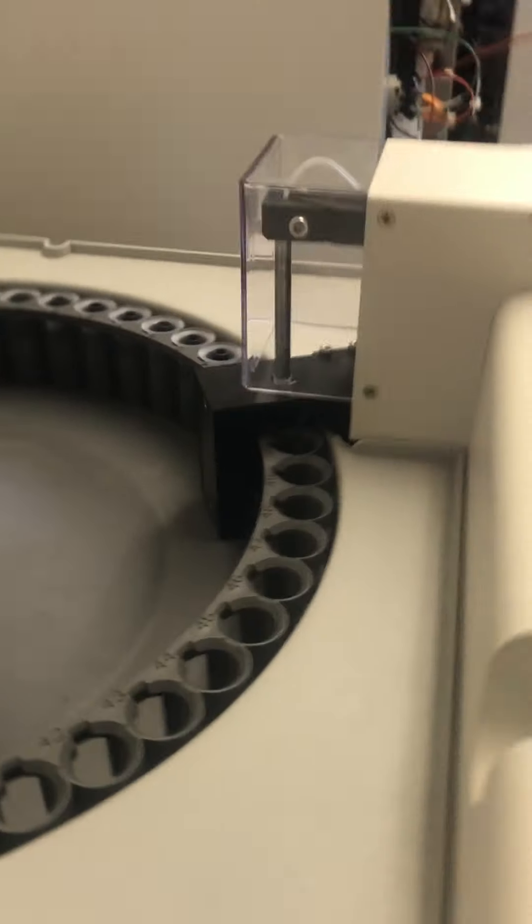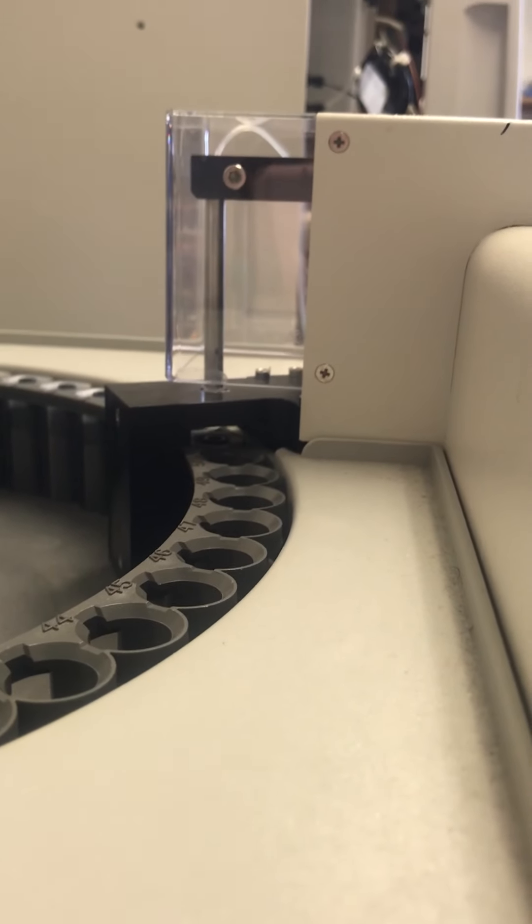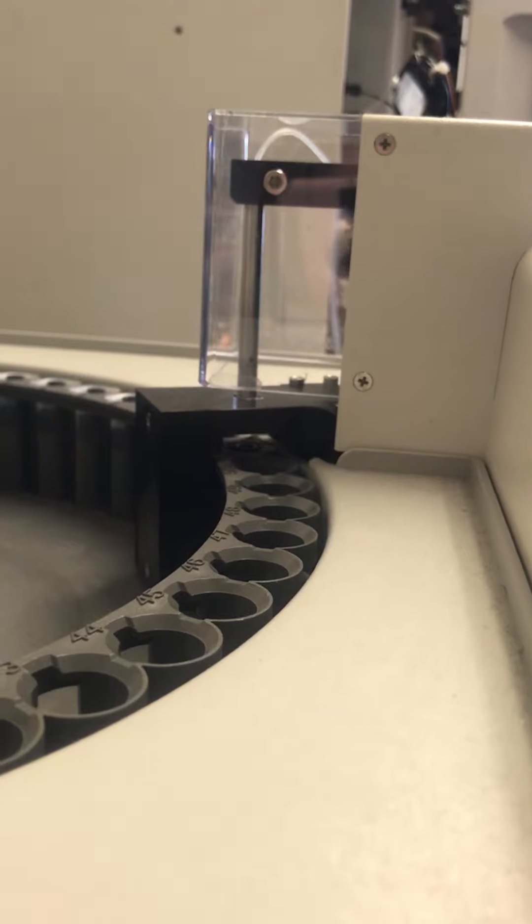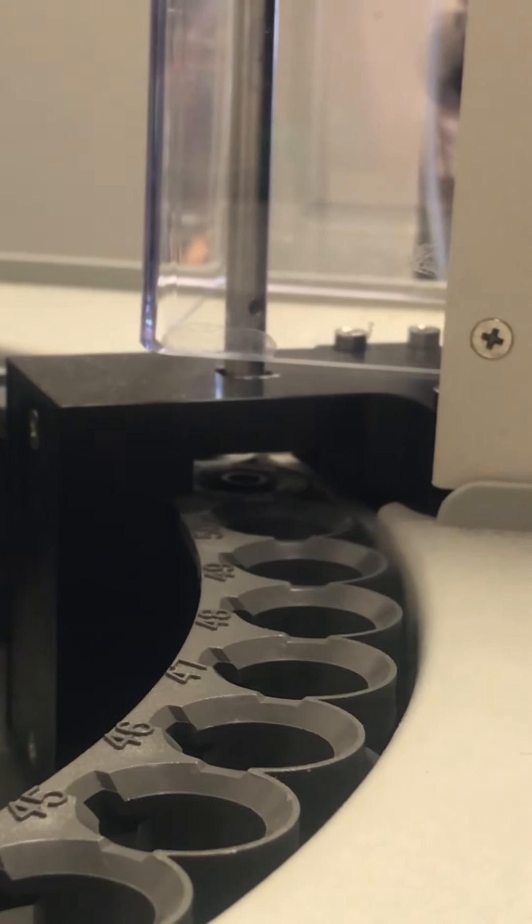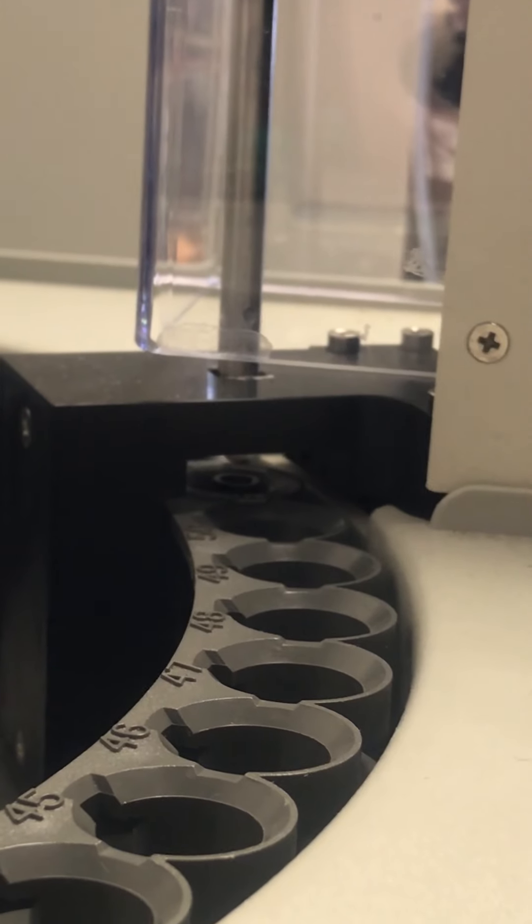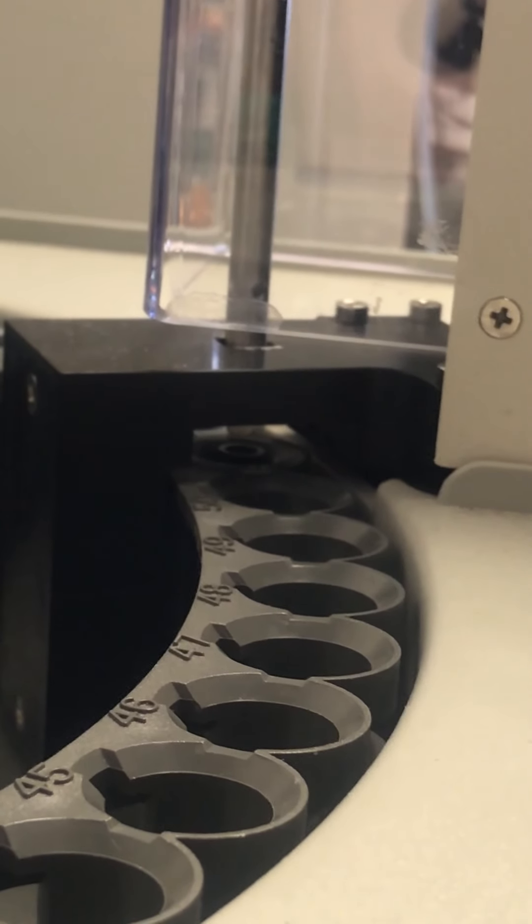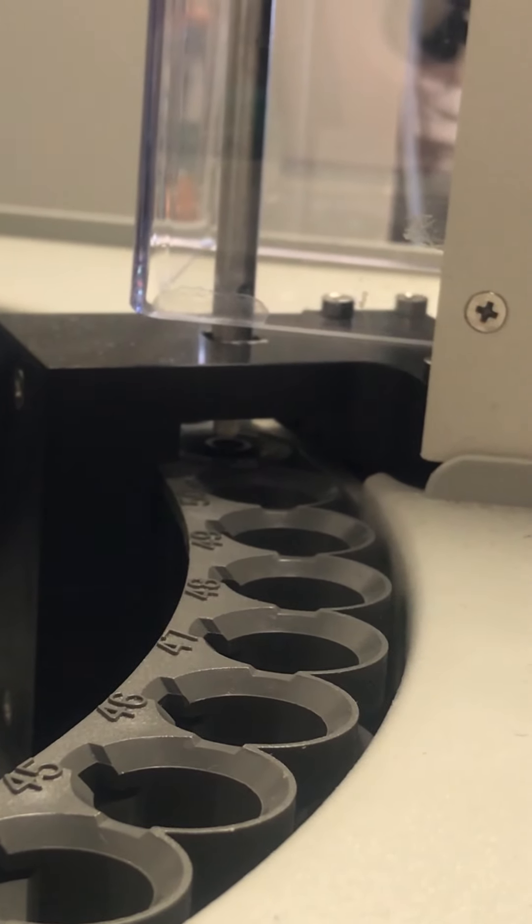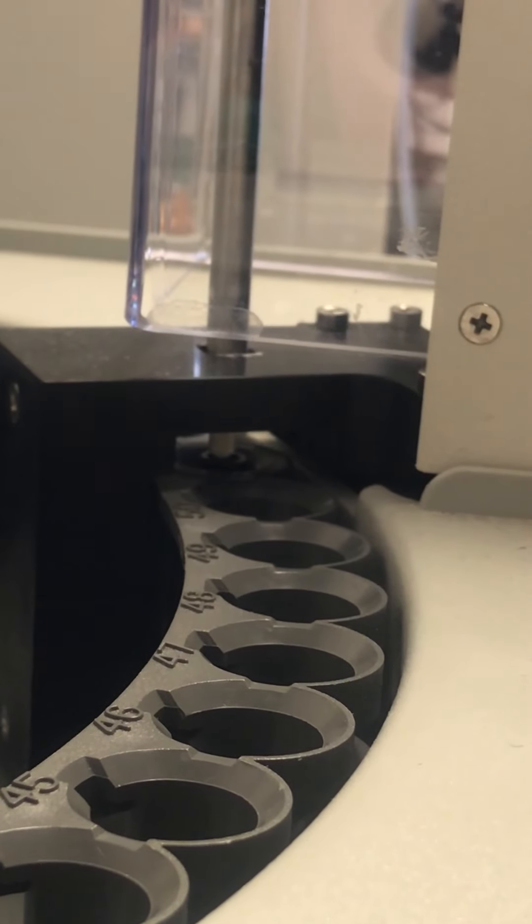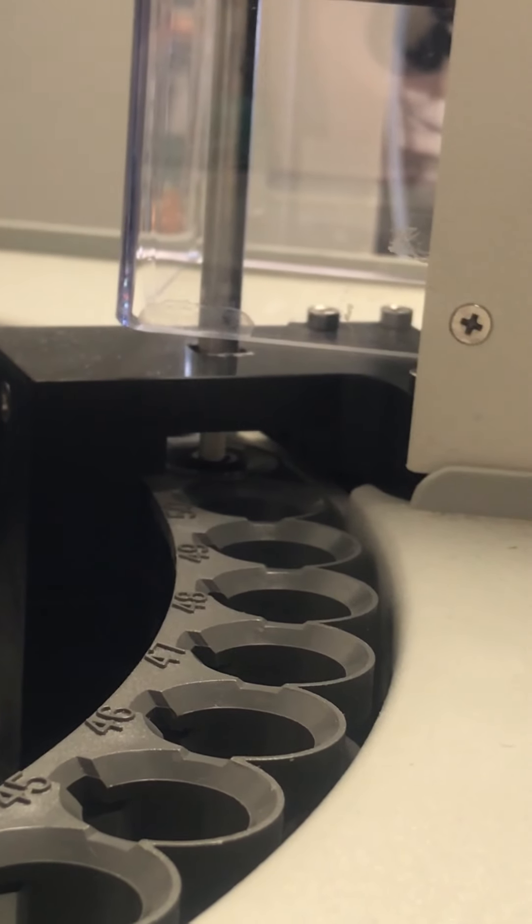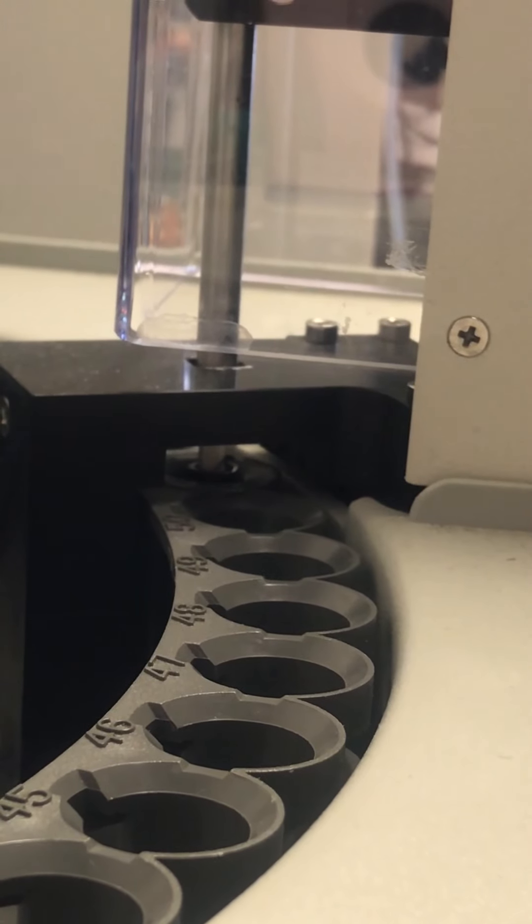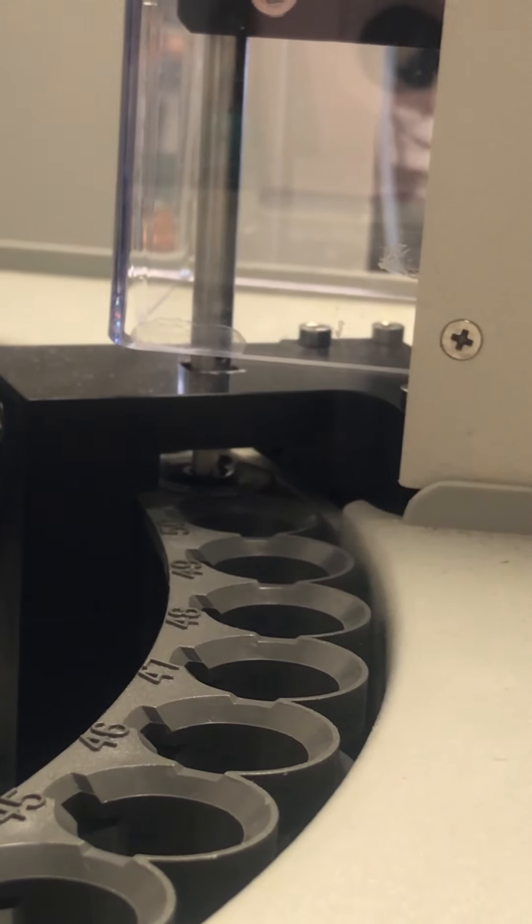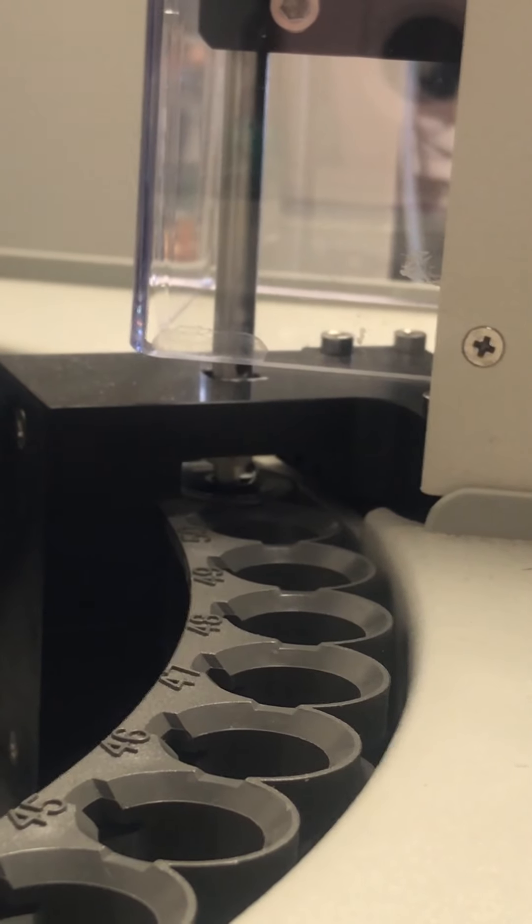Okay, let's see if we can get a good shot of the auto sampler. This is kind of hard to see, but that metal tubing is going down and it's going to plunge those caps that I fixed onto each sample down into the vial. A little bit of water spilling out, that's okay.